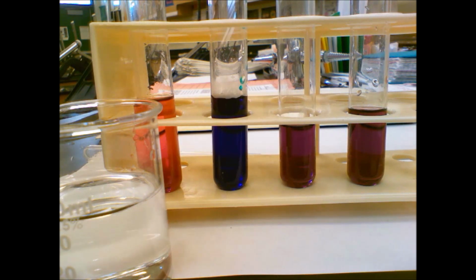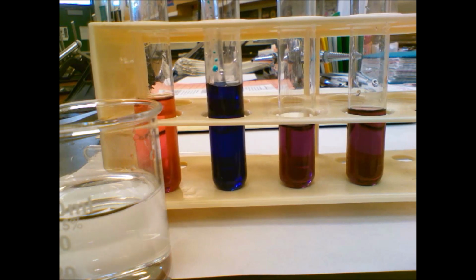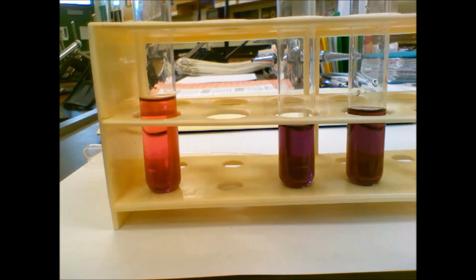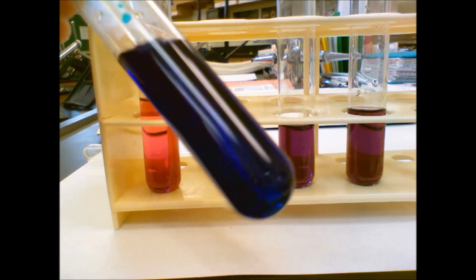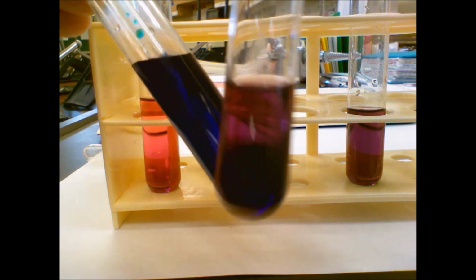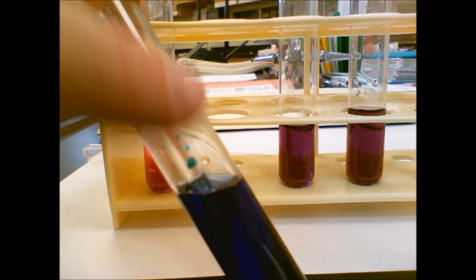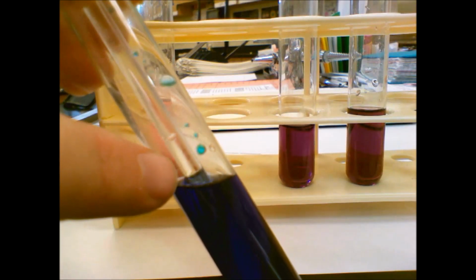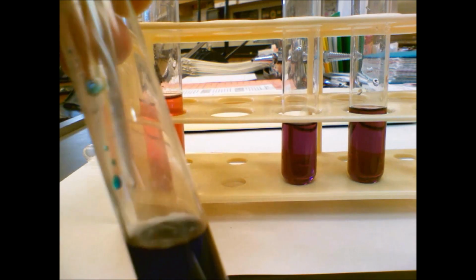Okay. So now we're going to stir this one. And this is one I really like. You get this beautiful cobalt blue from it. So we can compare it to our original purple. You can see it's definitely darker in blue. And you can see the little droplets on the top here. You get that nice, beautiful blue color. So there's some more droplets.